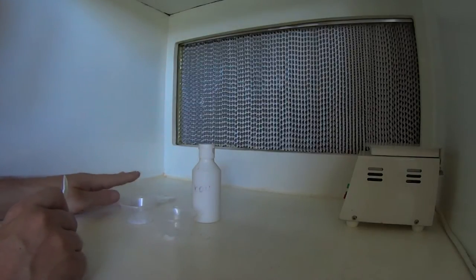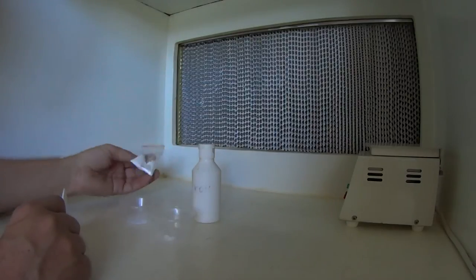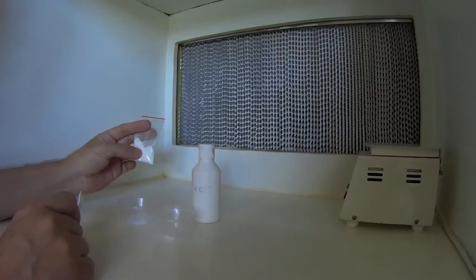All right, today I'm just going to do a video on how we go about dissolving some of our plant growth regulators. These are fairly pure chemicals and they need to be dissolved using another chemical.